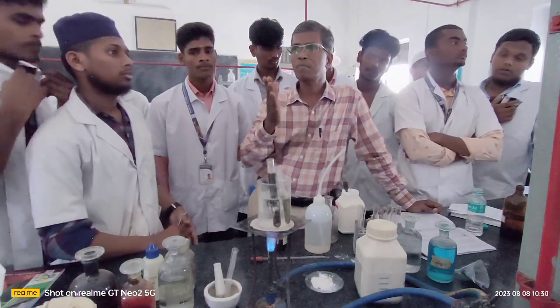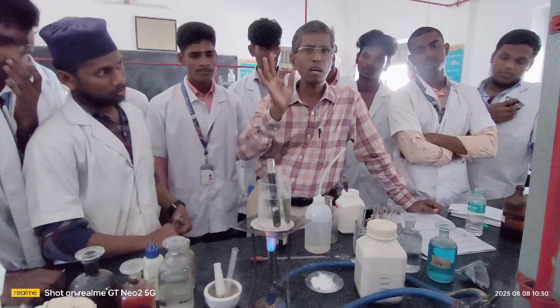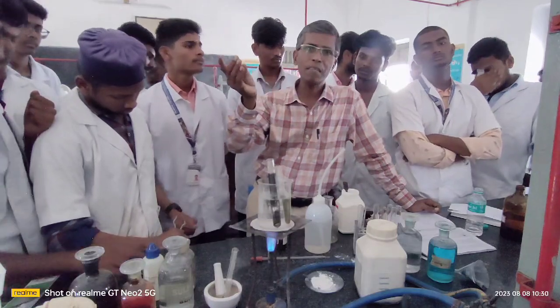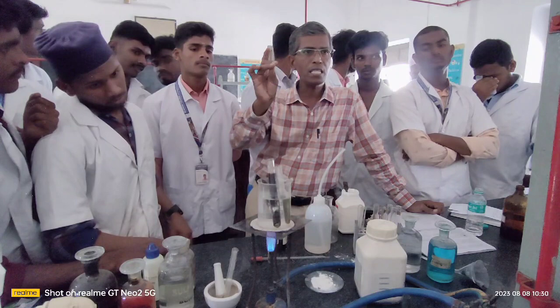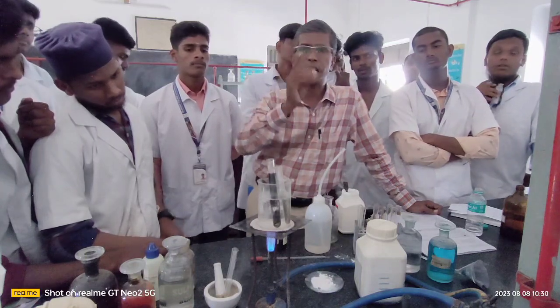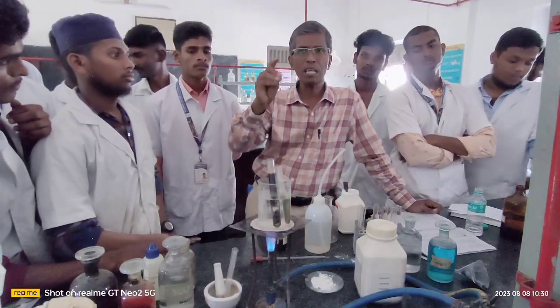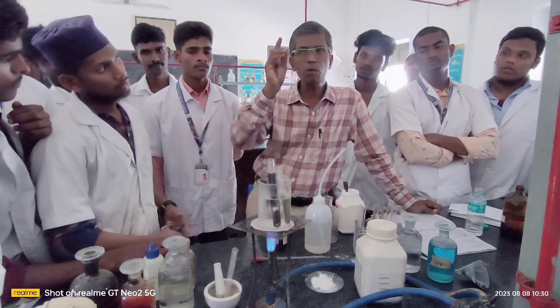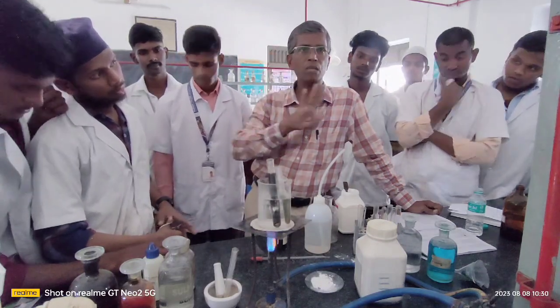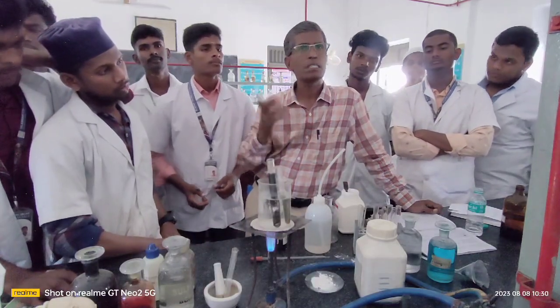Then I have explained how to confirm the presence of nitrogen with the help of sodium fusion extract. You follow strictly the preparation of the sodium fusion extract, and with it, add freshly prepared ferrous sulfate, then boil it by keeping it in your water bath, allow it to cool down, then add either dilute HCl or dilute sulfuric acid. If nitrogen is there in the organic compound, you will definitely get either a blue colored solution or a green colored solution. Otherwise, you can confirm on the spot that there is no nitrogen.